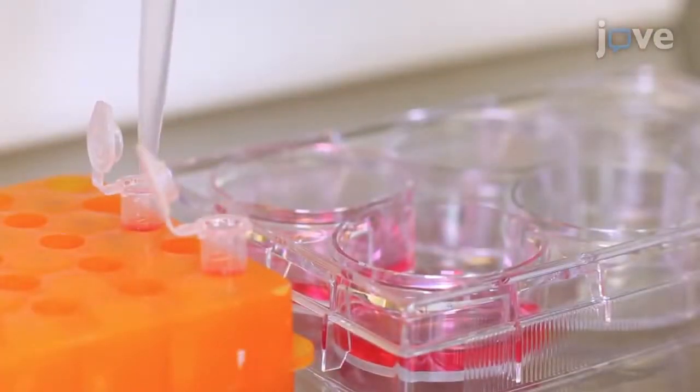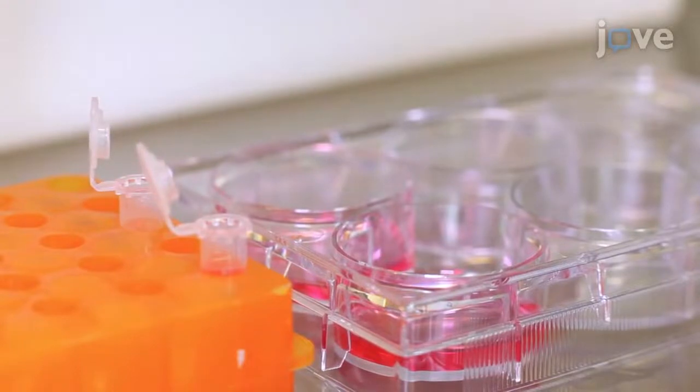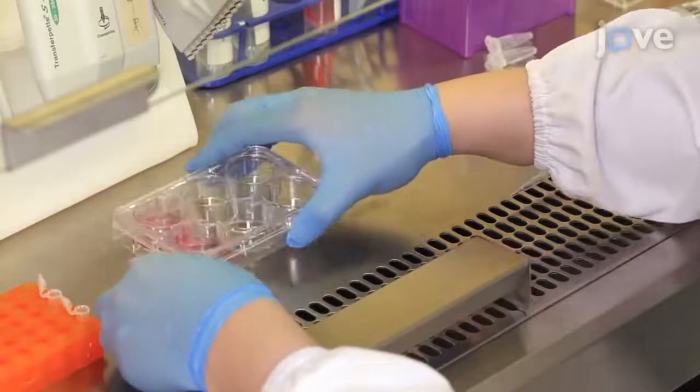Add the mixture to each well containing cells in medium. Mix gently by rocking the plate back and forth.